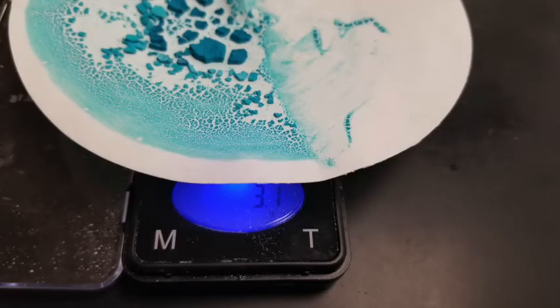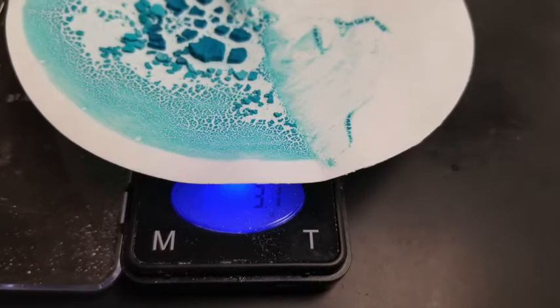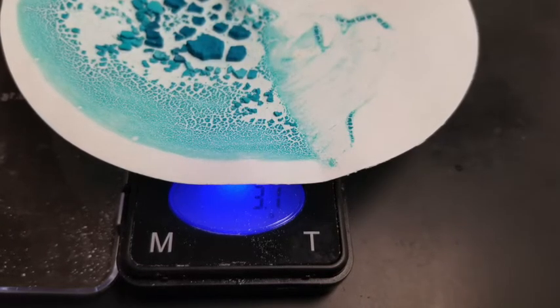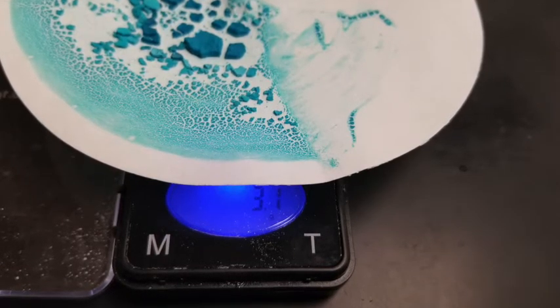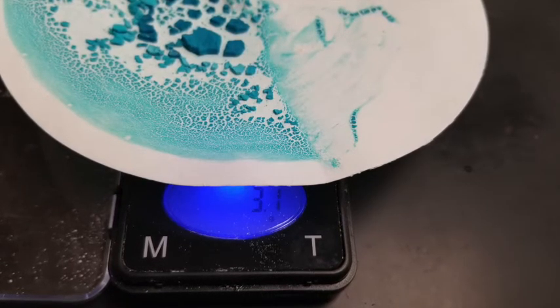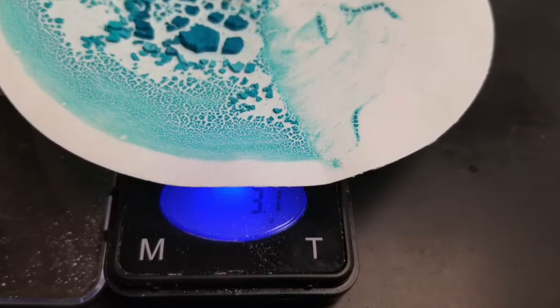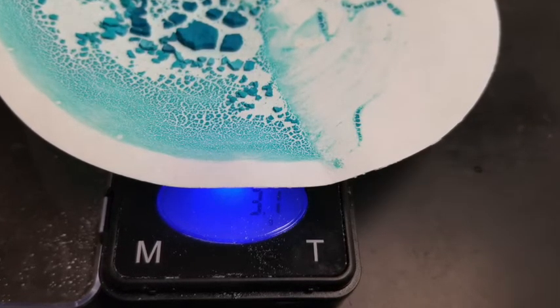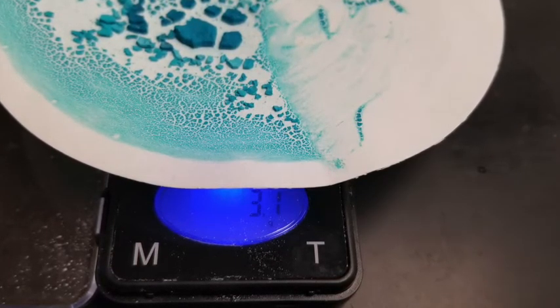Okay, so what I'm going to do now is let that cook for a while and pull it out. When I've pulled it out of the oven, it looks a lot different than when it went in. But I don't know if it's done yet or not. So the only way I can tell is to weigh it and then put it back in and see if after a little more time the weight actually goes down. Right now it's at about 3.1 grams, the filter paper with the precipitate caught on top. But I'm going to put it back into the oven and let it cook a little bit more.